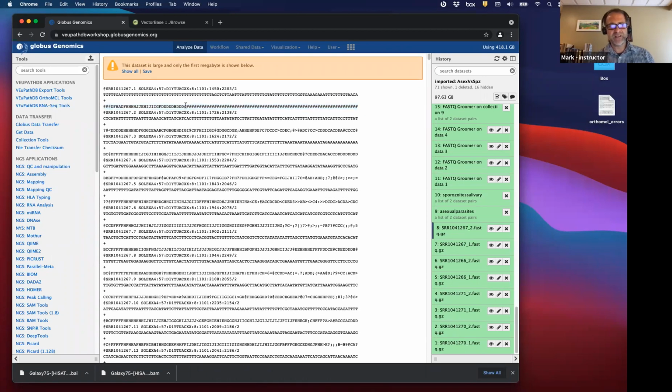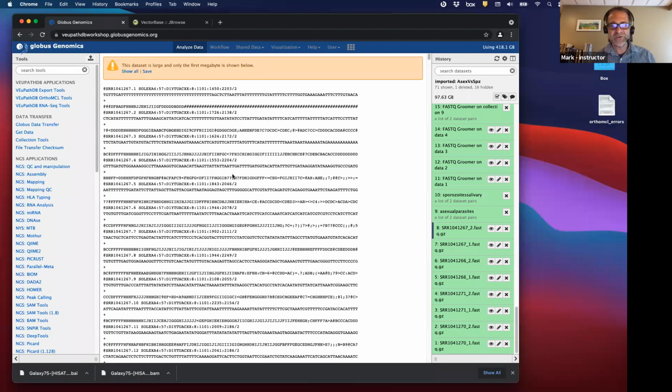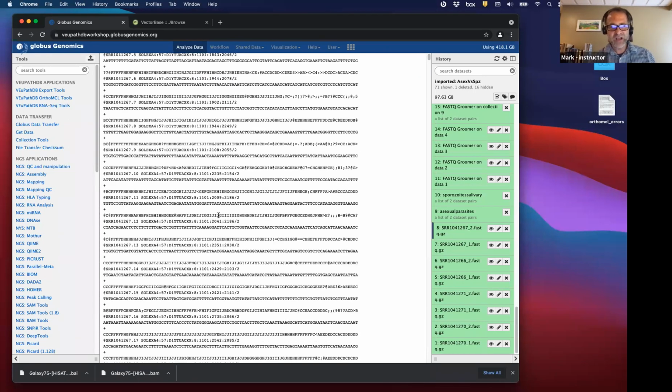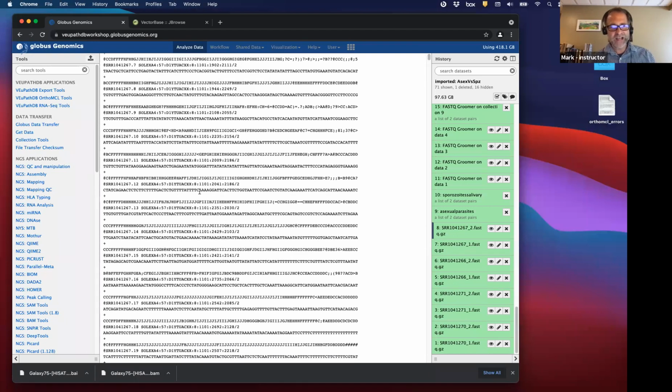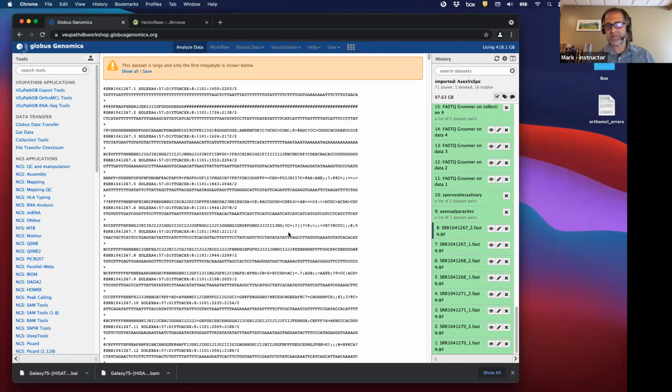And I believe the number sign, one of these symbols, is a not good score. And once you get used to these files, if you see a lot of, say, number signs or characters that you know mean it's a bad score, you should be concerned. But in general, I look through this and I see a lot of letters, and those letters, for ASCII characters, mean a really good score. So in general, the scores look pretty good for the FastQ files. It's formatted as I would expect.